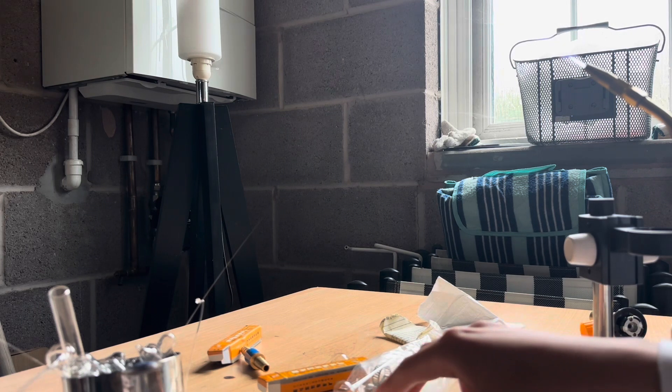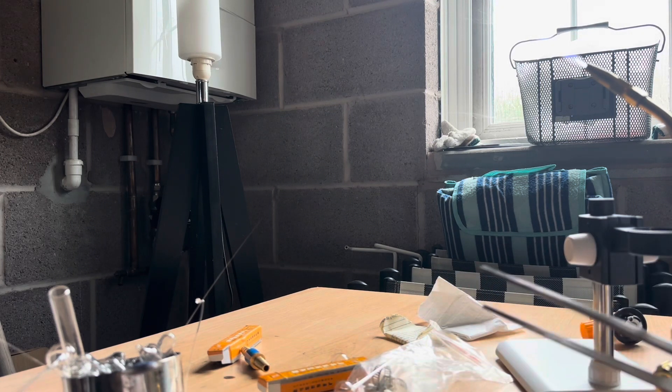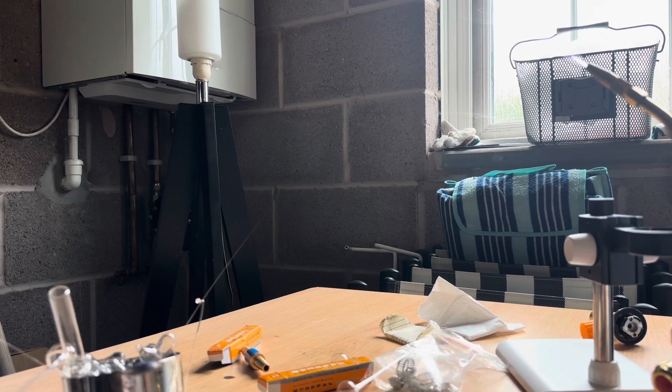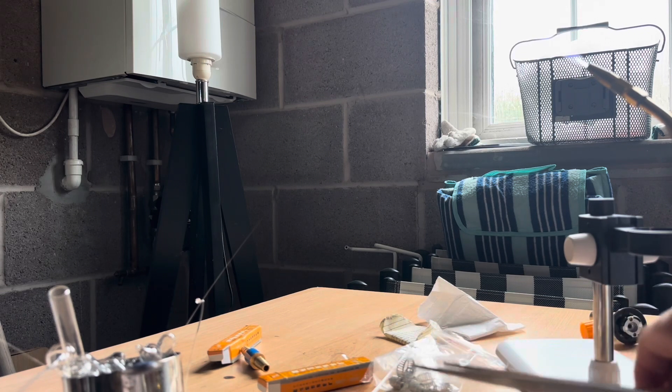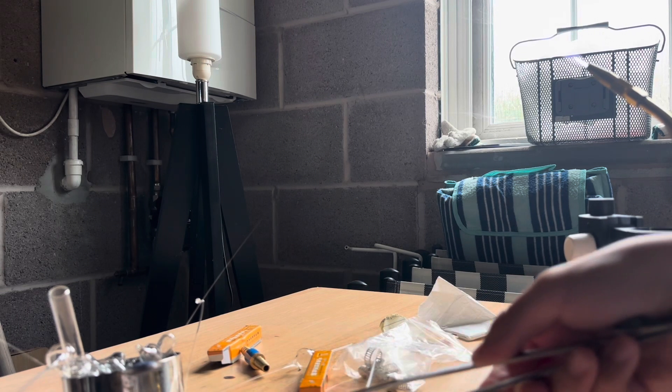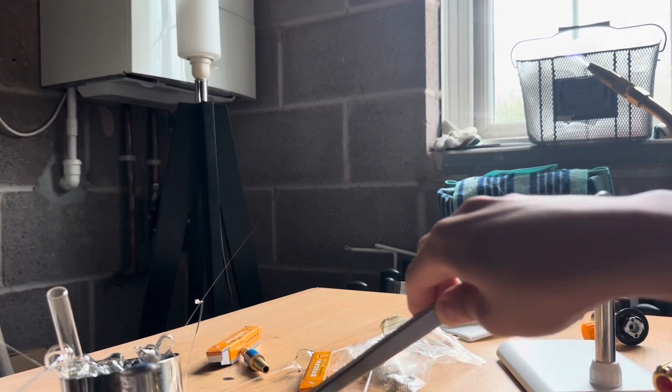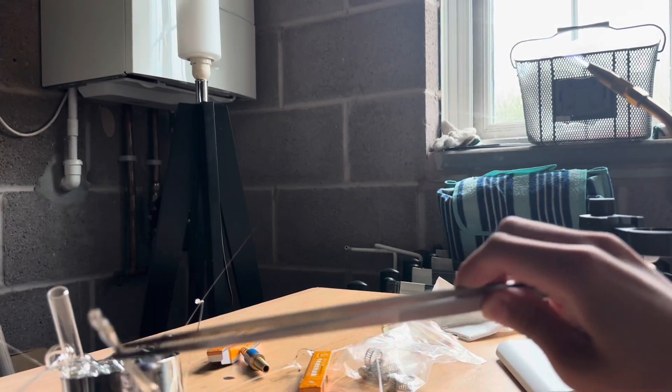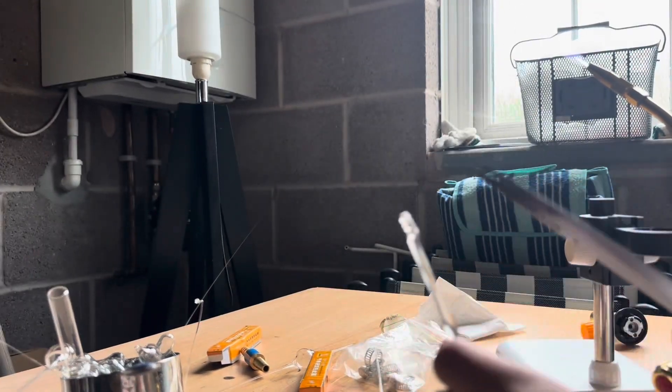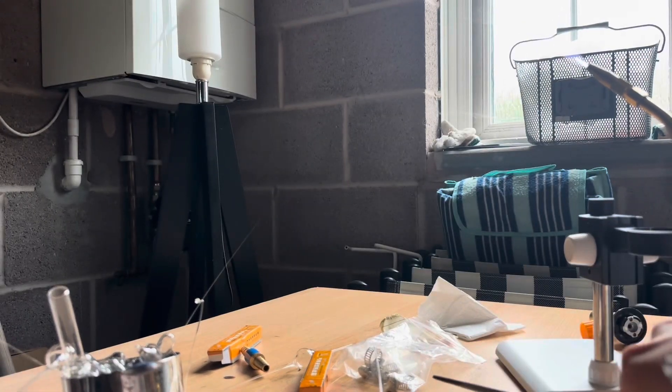We need to find ourselves a glass rod that can be used to score the glass. Here, we use this glass rod over here. The glass rod makes sure it has to be thick enough, so it has enough thermal mass in the end to create the scratch.